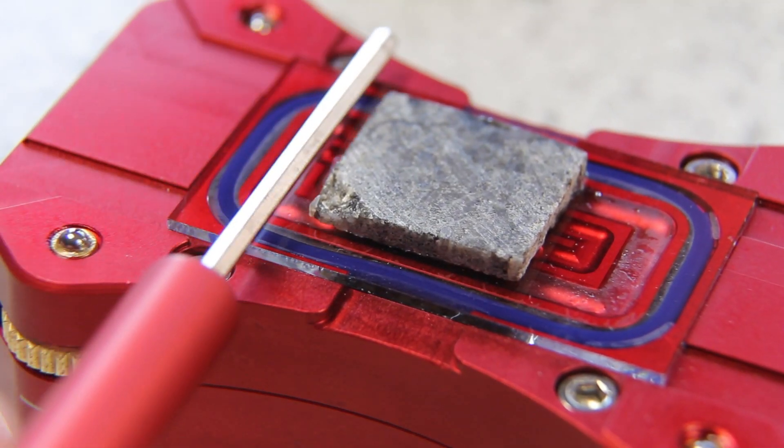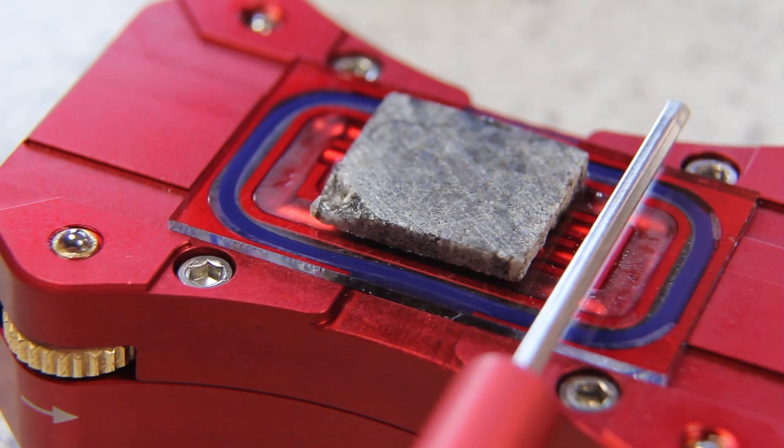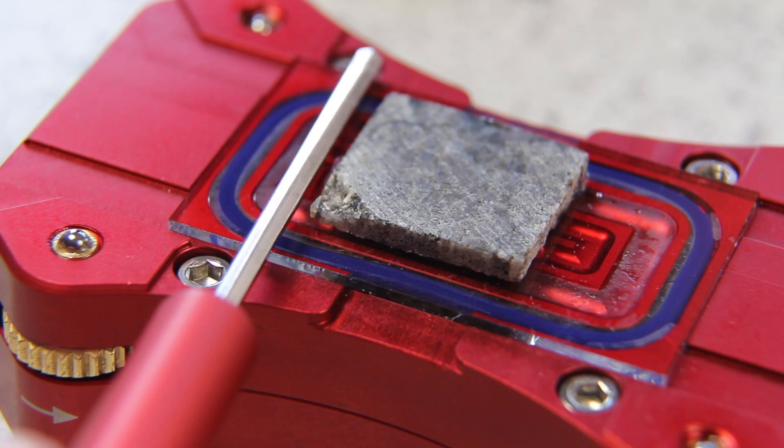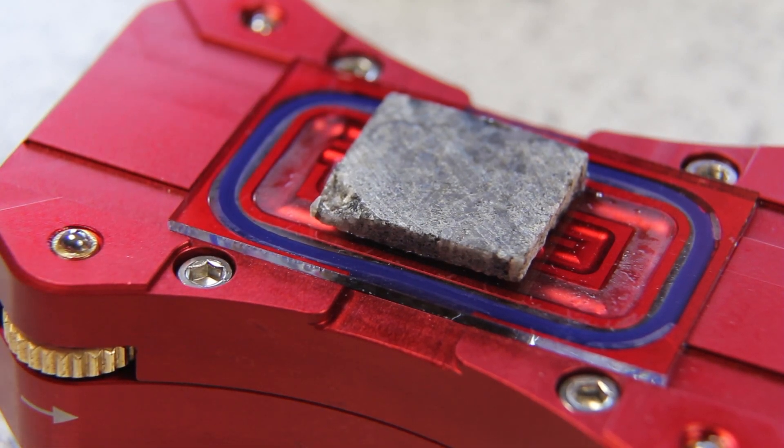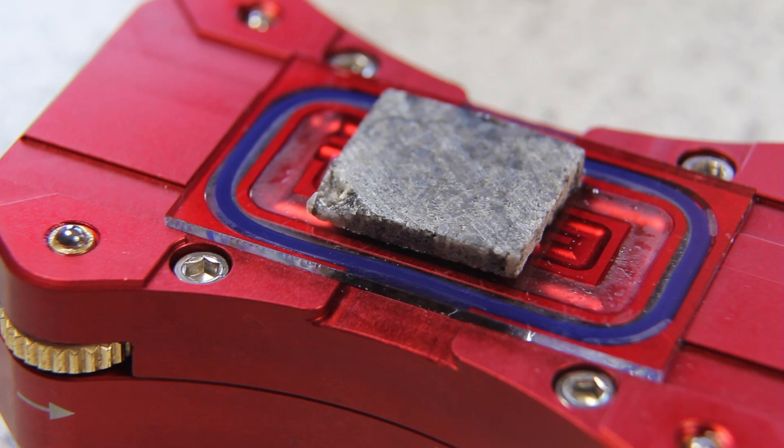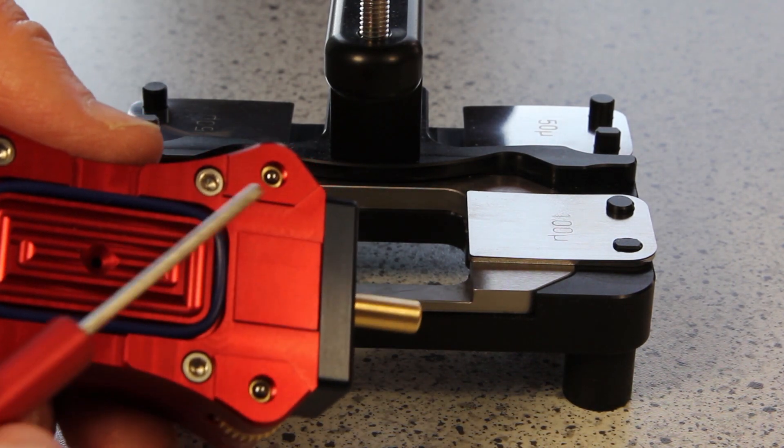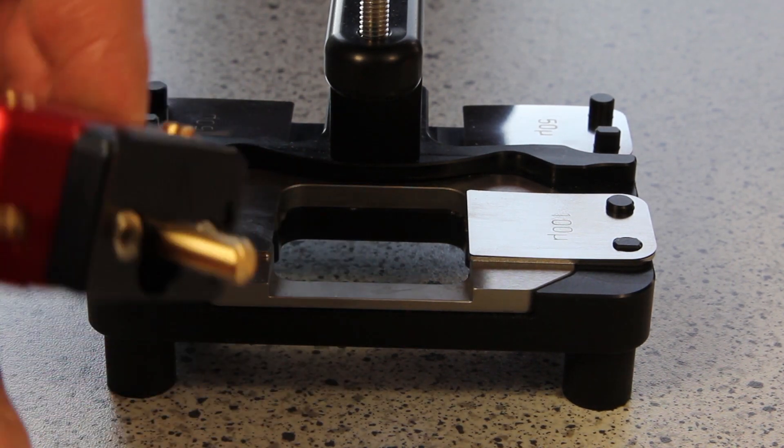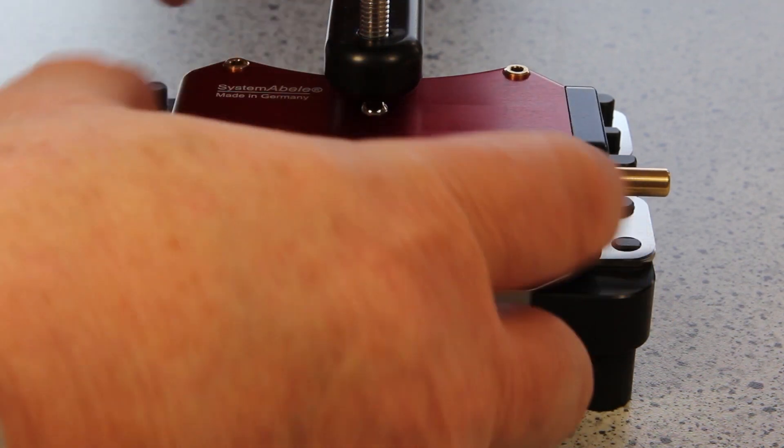These surfaces on this side and on this side have to be completely clean. No dirt and no resin is allowed. Now I make sure again that the feet are complete inside. And I put the mouse into the setting device.